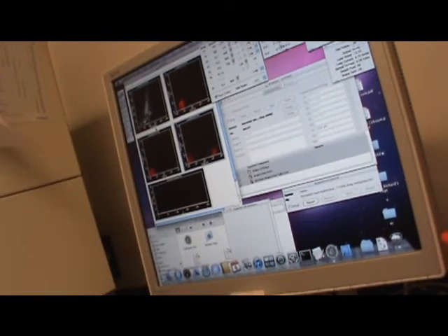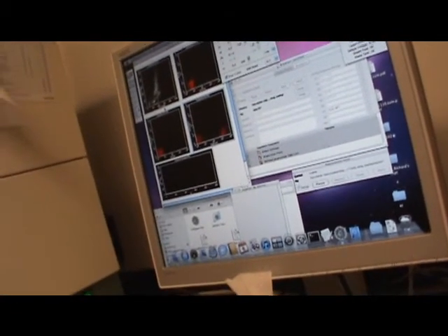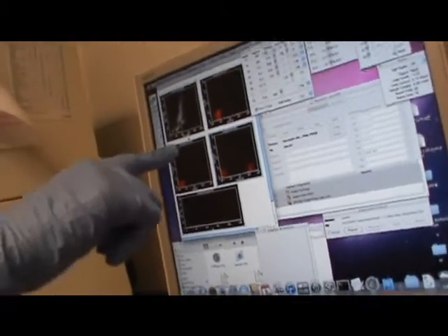It depends on the antibodies also. It is not that what I stain should be perfect for everybody, because your antibody would be different. The fluorescence parameter you're using could be different. It could be behaving differently. It could be spilling into the next channel. So you have to make sure that you correct the compensation. Once you know how to do it, you can just play with that stuff.